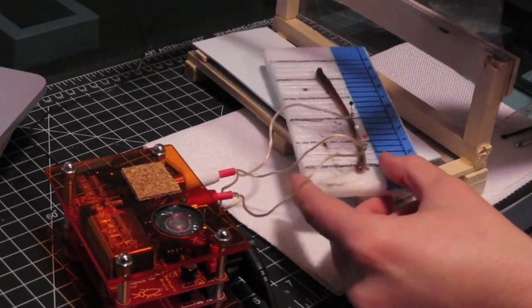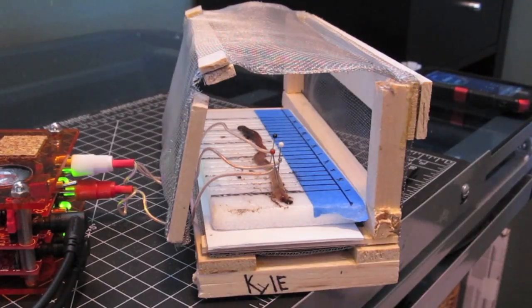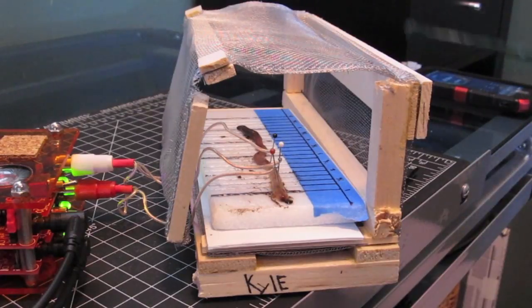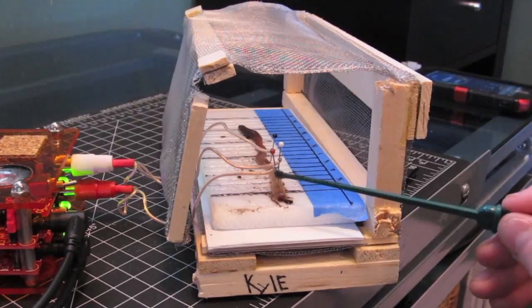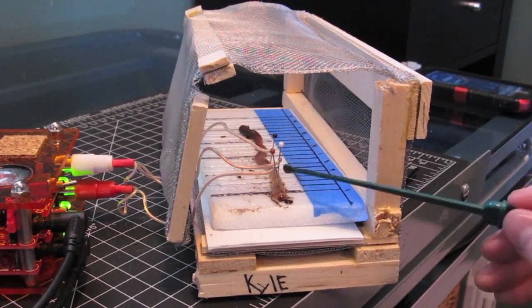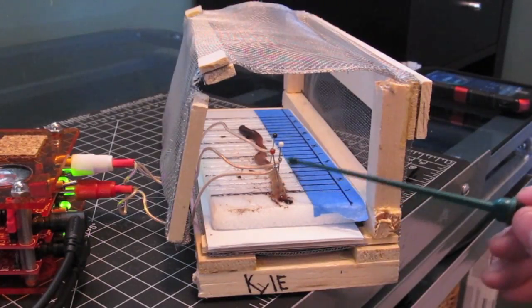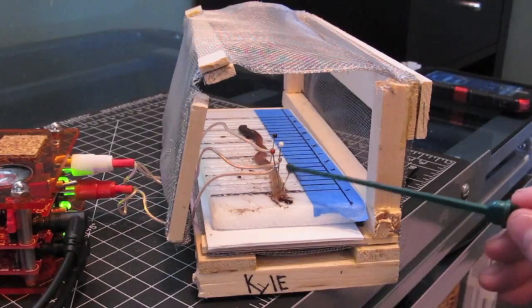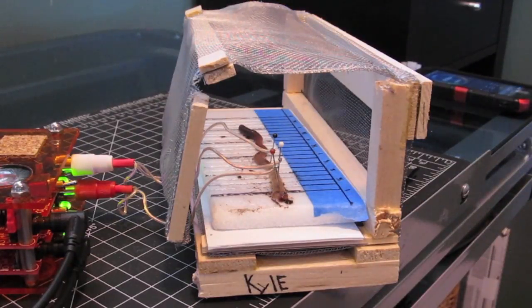Now place the earthworm into the Faraday cage with the worm's posterior end facing towards you. Once the spiker box is turned on and Audacity is recording, you will start recording from the posterior or back end of the worm. Now let's listen for the sound of some glorious, beautiful spikes. When you touch the posterior end of the worm, you hear some great sounding spikes. Once you hear those great sounding spikes, you will want to turn off the spiker box, but you must not stop Audacity. Allow it to continue recording without interruption.